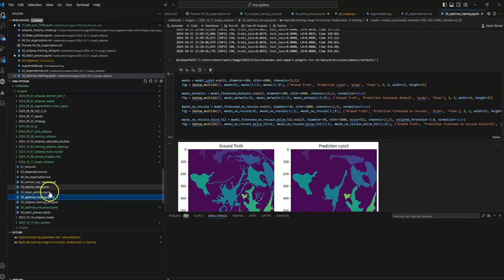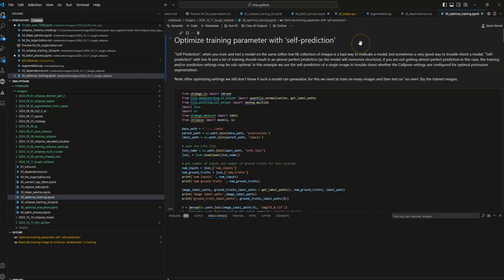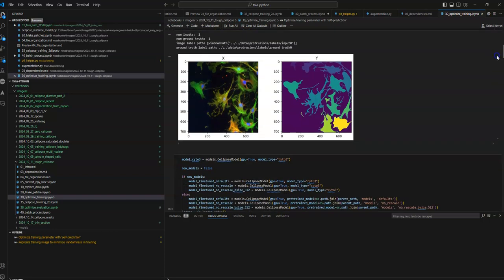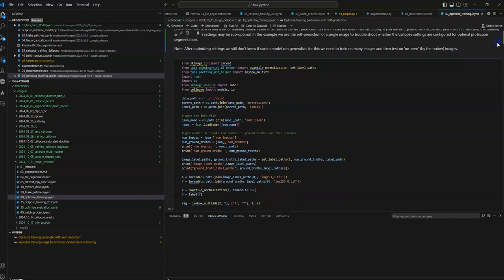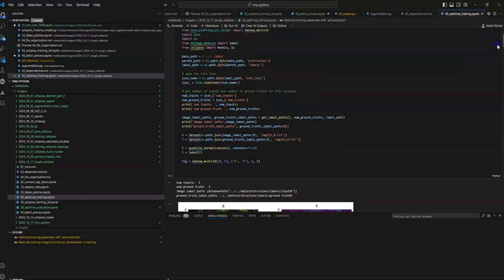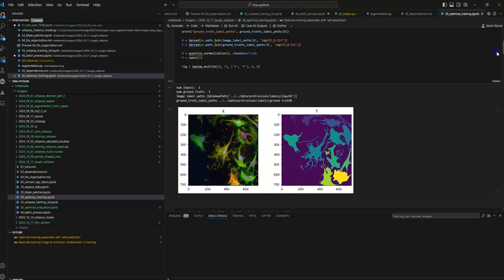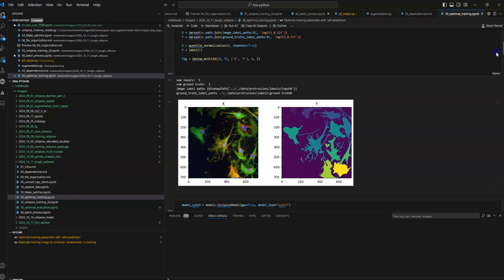Then for this problem, I had a notebook here called Optimize Training, and this one is kind of interesting because I actually do a little trick here. I train a model, totally overfitting a model to one image, because I want to test whether the model is actually able to encode the image structure. If you train on one image, it should just memorize that image, and if it can't do that, it might indicate that the design of your neural network, or the way you're approaching training, has some parameters wrong, or maybe the approach you're using can't even fit the data you want it to. So the entire goal of this optimized training with self prediction is to train on just this one example and see if I can get it perfectly.